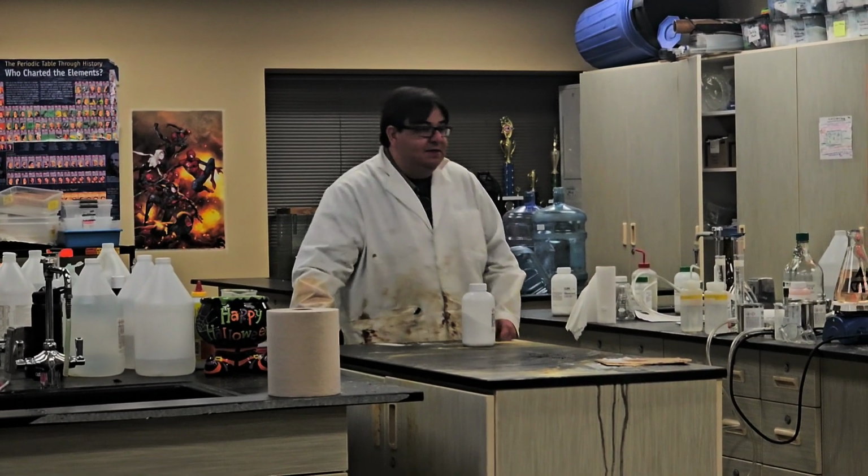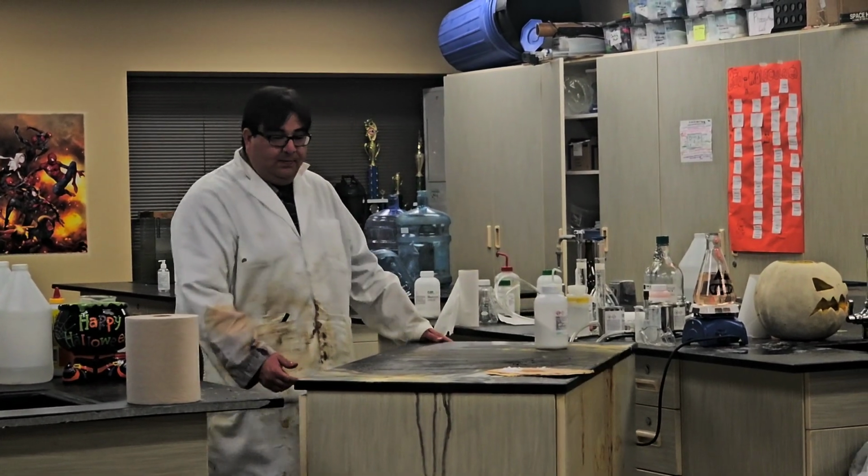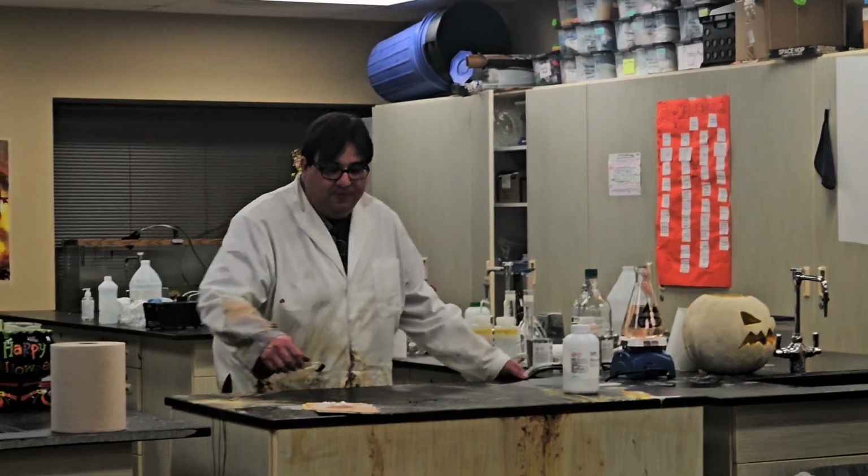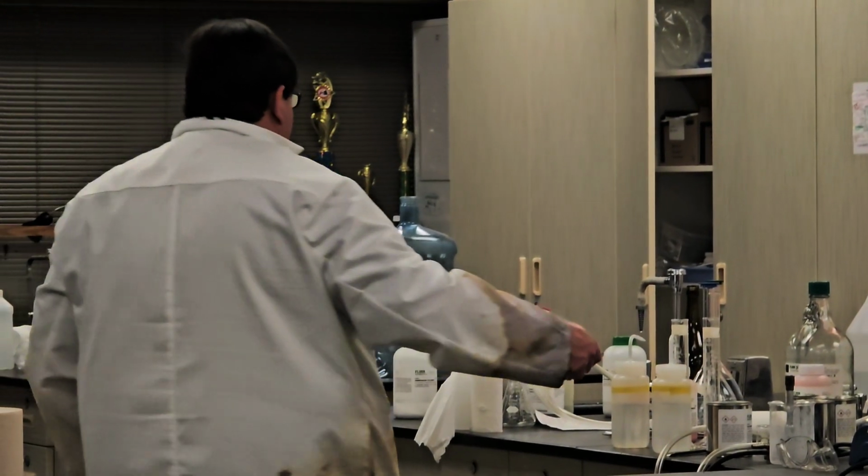So while I'm setting up this next one, I'm going to need your help. You guys have to think about this reaction, or else it doesn't work. Think.